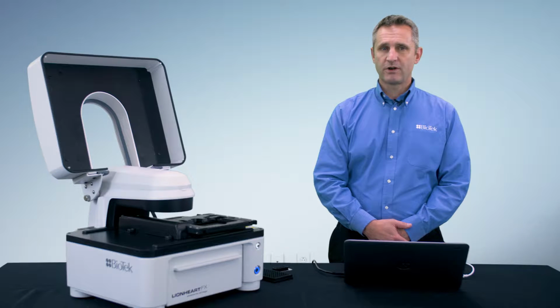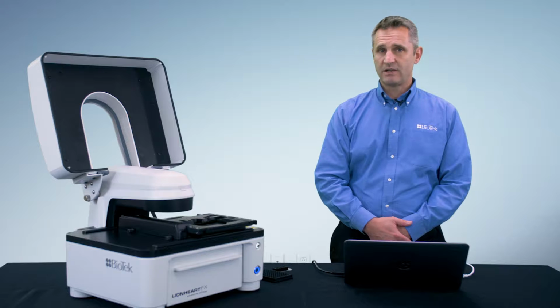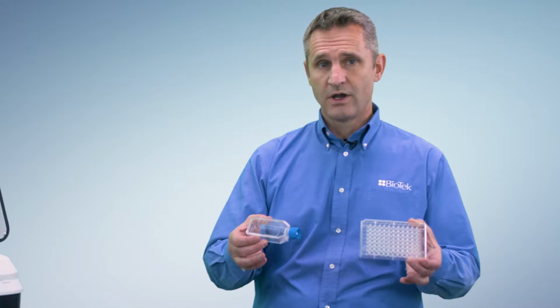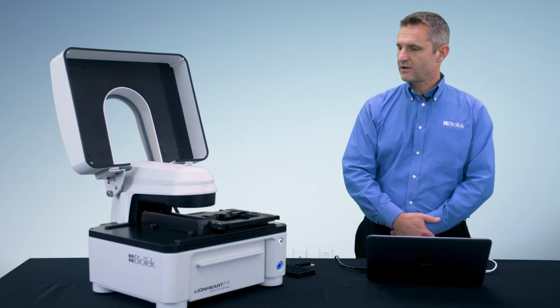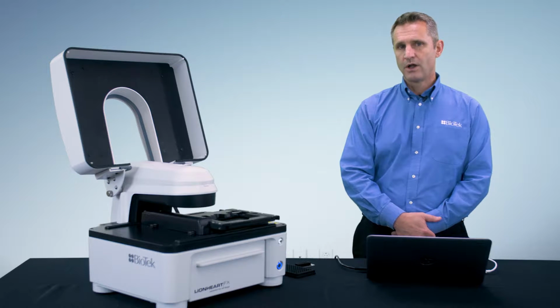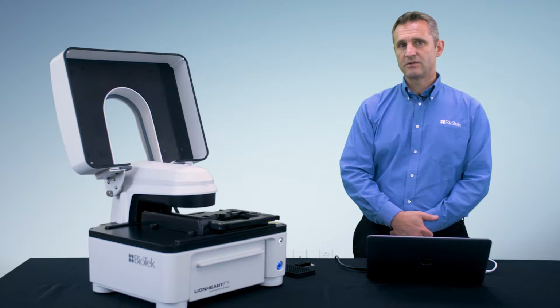I am manager of product marketing at BioTek, and in this video we're going to talk about automated imaging and more specifically how to define sample vessel parameters in the Gen5 software and why it is so important. What you can see here is a Lionheart FX automated microscope, but this video actually applies to any of BioTek's imaging systems. So before I explain to you how you set up the parameters in the software, let me explain to you briefly why it's important.